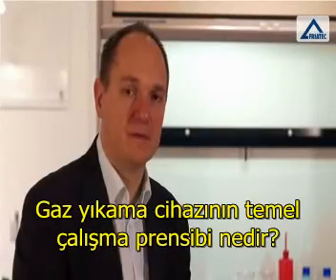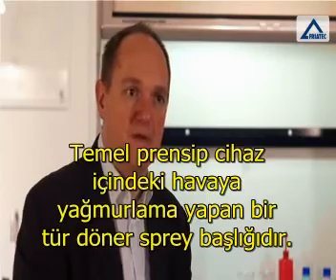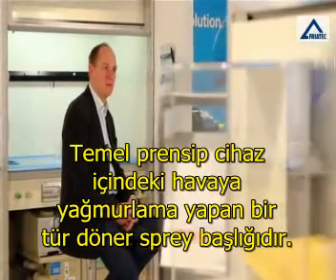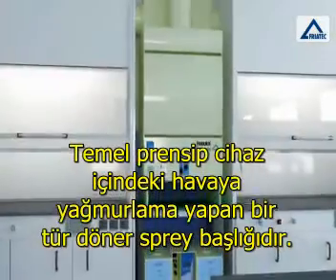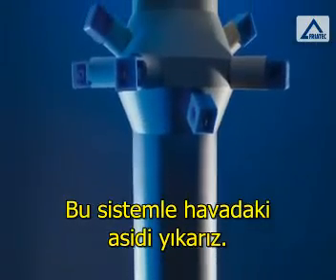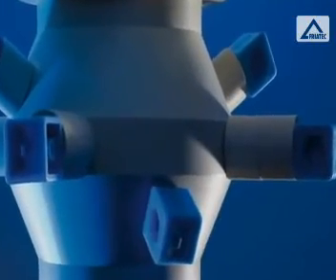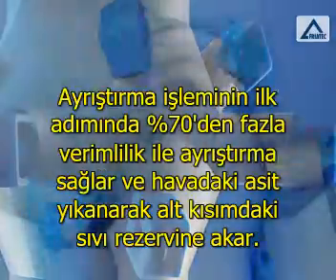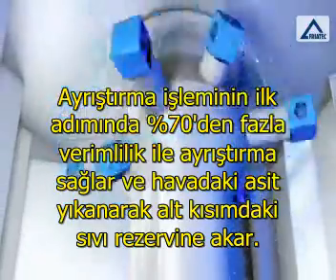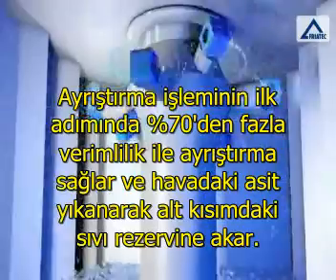What is the main principle of the fume scrubber construction? The main principle is to have a sort of spray wheel inside that makes a big spray mist inside this spray cabinet. In this spray mist we wash out the acids from the air. This first step of separation has an efficiency in itself of more than 70% of the acids coming out of the air and washing down into the liquid.